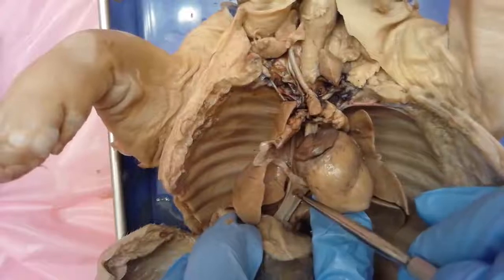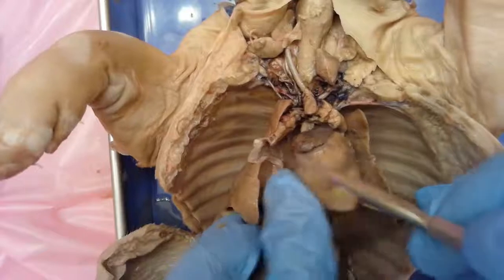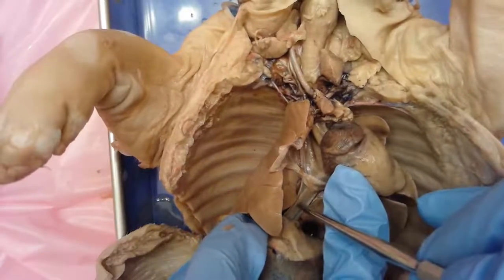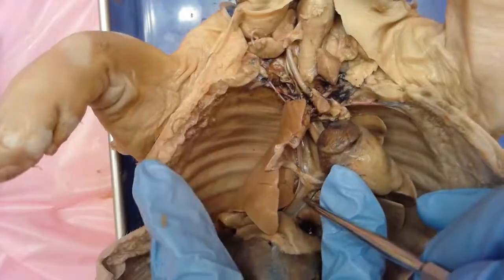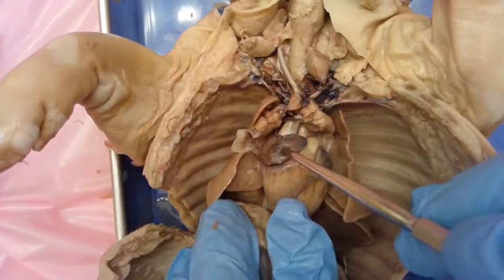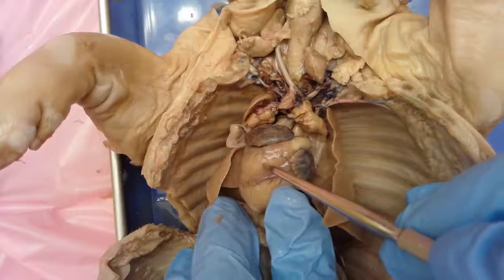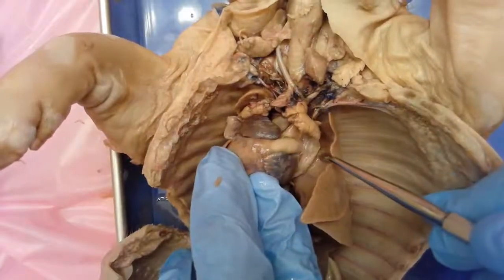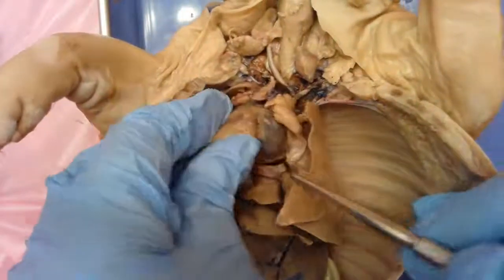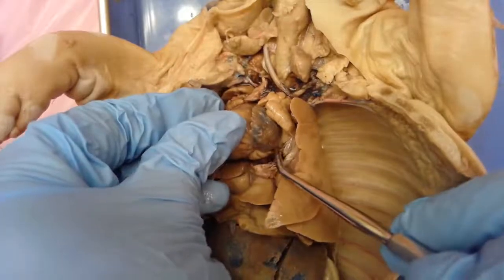And coming from the lower body, this part right here is going to be the posterior vena cava, or in humans it would be the inferior vena cava. Both of these veins are actually bringing blood that has circulated through the body — deoxygenated blood that now needs to pick up oxygen. As it needs to pick up oxygen, it's going to get sent to the right atrium. From the right atrium, it goes to the right ventricle. From the right ventricle, it's going to go through this pulmonary artery to the lungs to pick up oxygen.